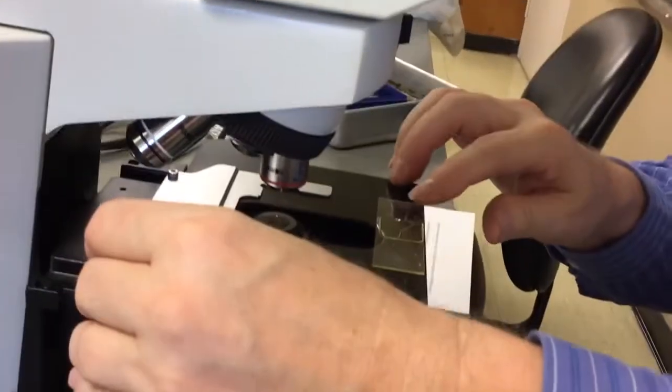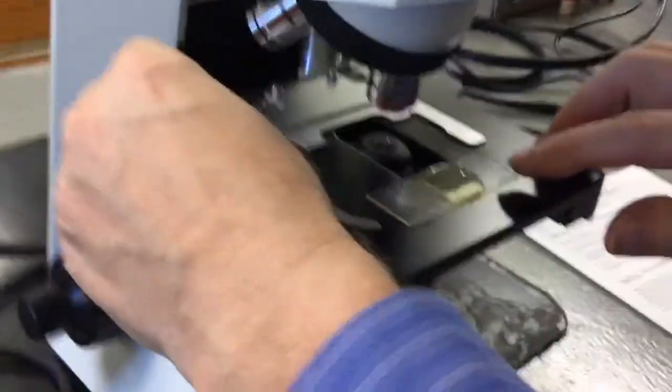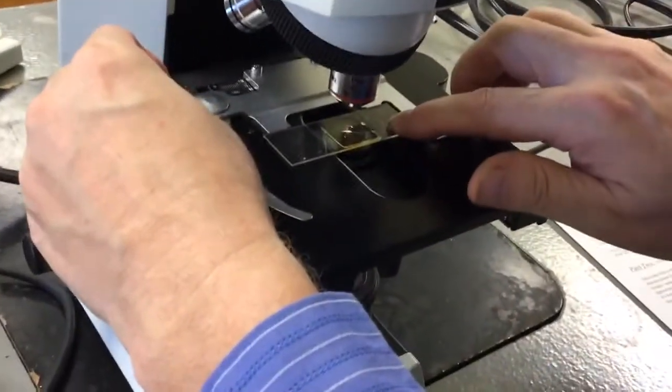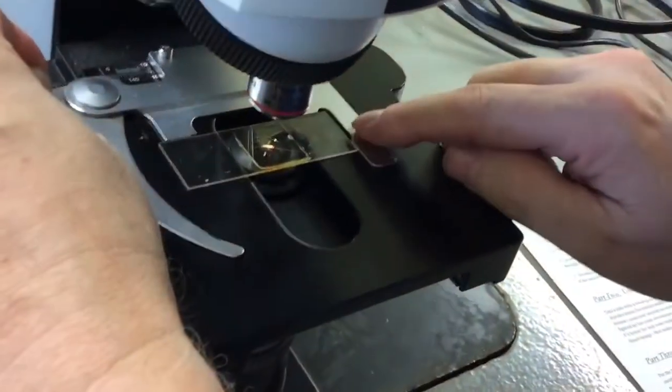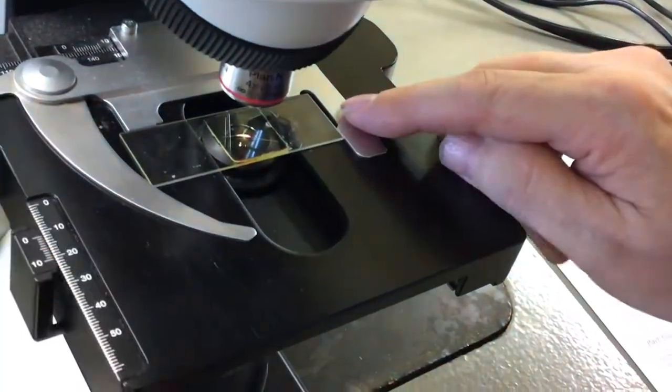Now I'm going to take this slide, which I have cleaned already. I cleaned it off ahead of time. You always clean your slides, otherwise you're looking at dust a lot. I'm going to take the slide just the way you looked at it and put it flat down on the scope. Open the little flippy thing. That is the technical term for it, the little flippy thing. You always put the slide in to the bracket as far back and in the corner as it will go, and gently close the flippy thing.